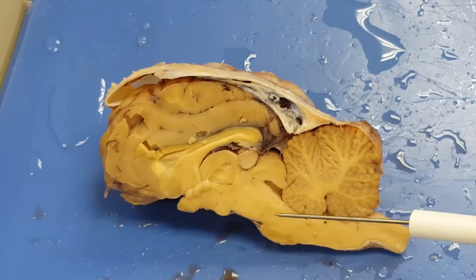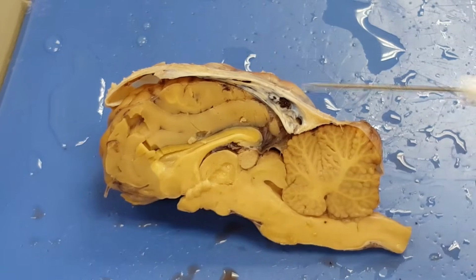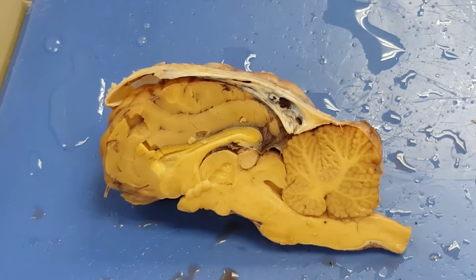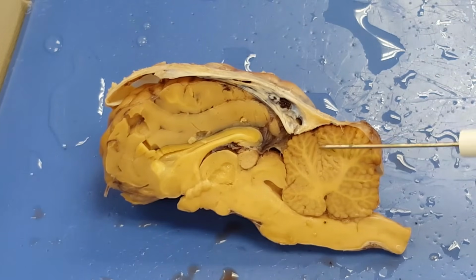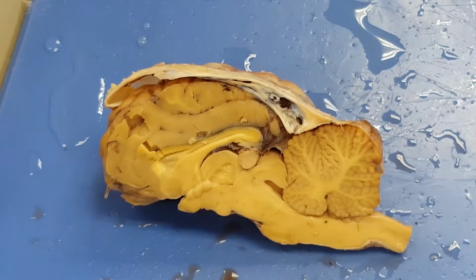And I can see above them the midbrain, right here. Now I want you to look at your list on page 5. Do you see midbrain anywhere on that list? No, you don't. So I can't ask you midbrain. I can ask you cerebellum. I can ask you medulla oblongata. I can ask you pons. But I can't ask you midbrain.